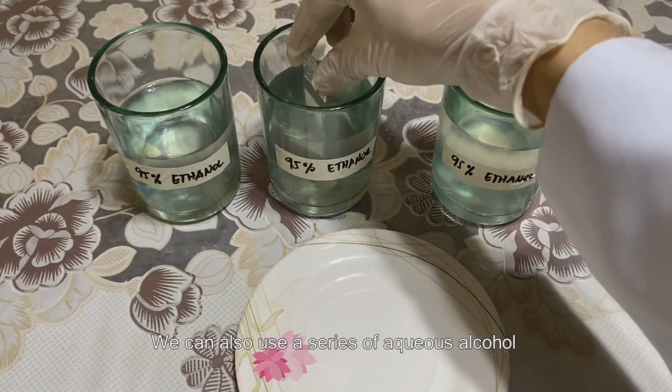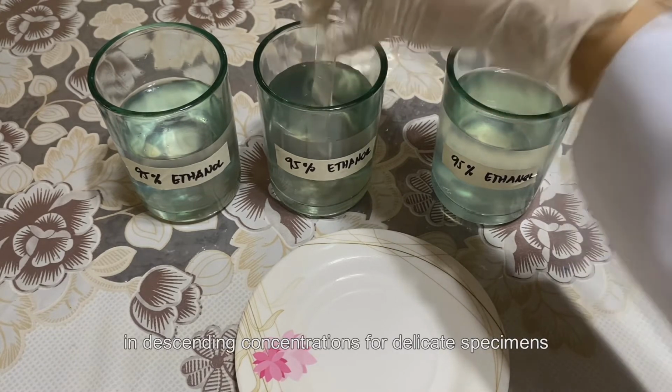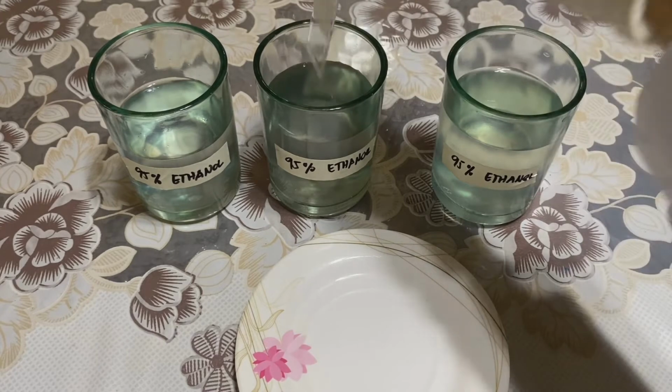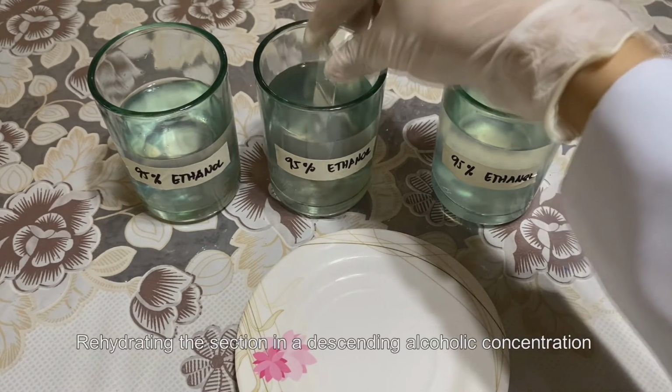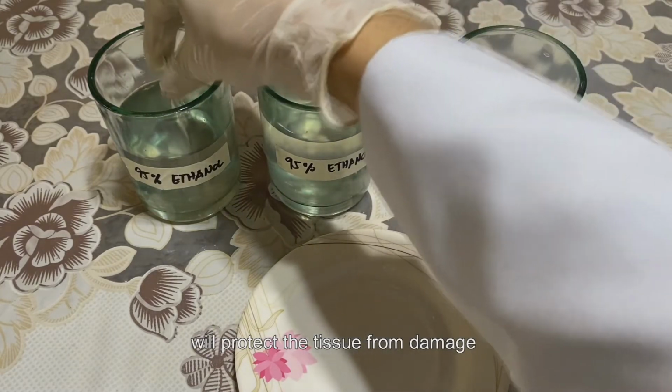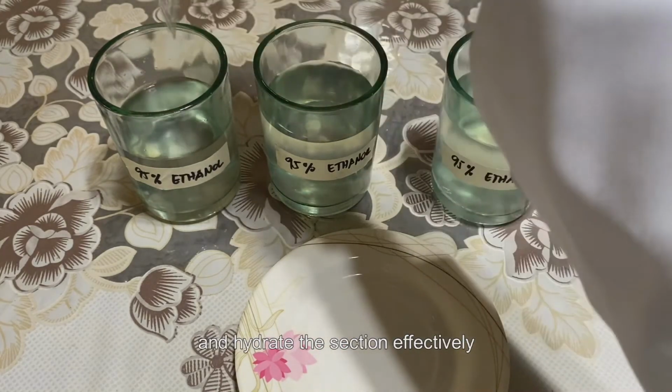We can also use a series of aqueous alcohol in descending concentrations for delicate specimens. Rehydrating the section in a descending alcoholic concentration will protect the tissue from damage and hydrate the section effectively.